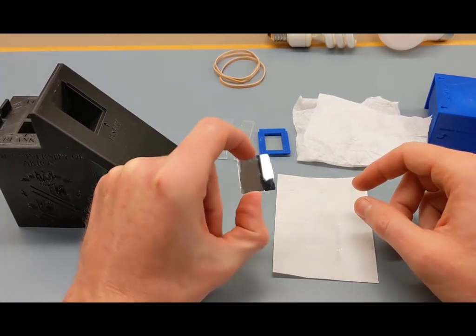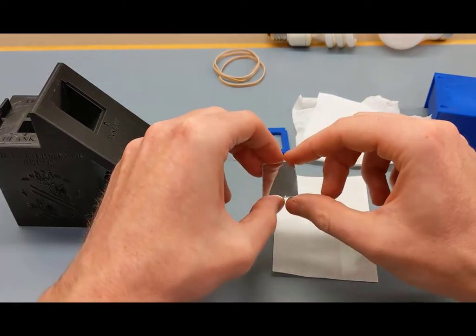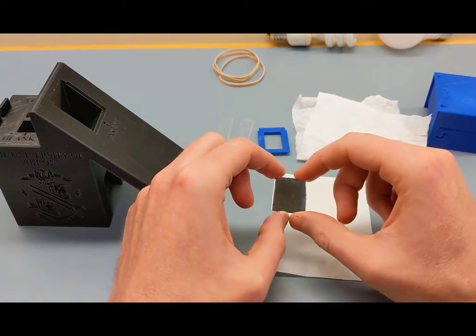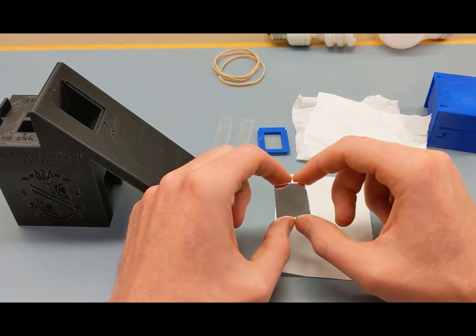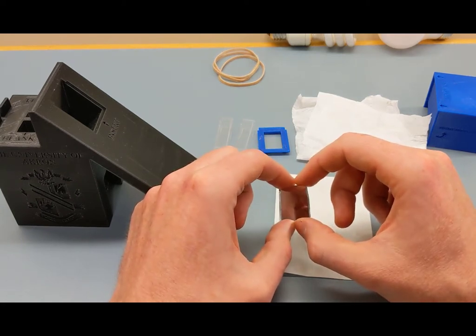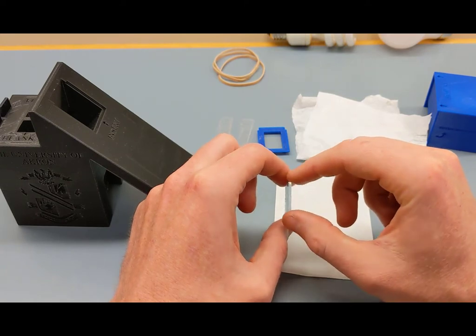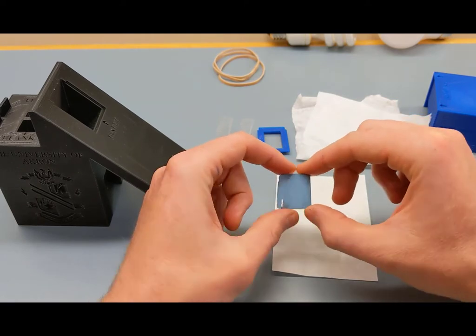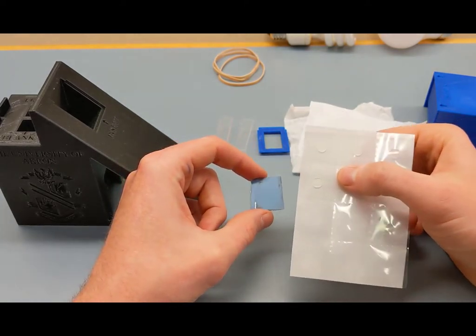This is a good time to grab your gloves. Your mirrors might not be completely clean and we don't want to leave any fingerprints on them. We'll clean them after assembly, but wearing gloves prevents that issue. Flip the mirror over, and you should have a sheet of glue dots.